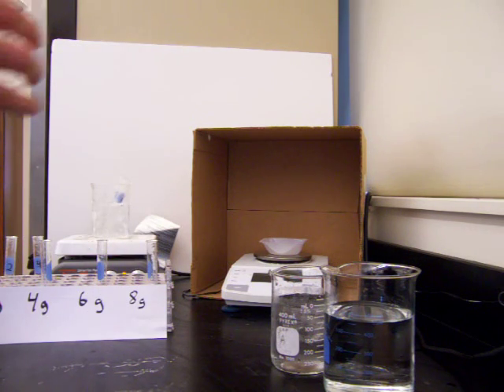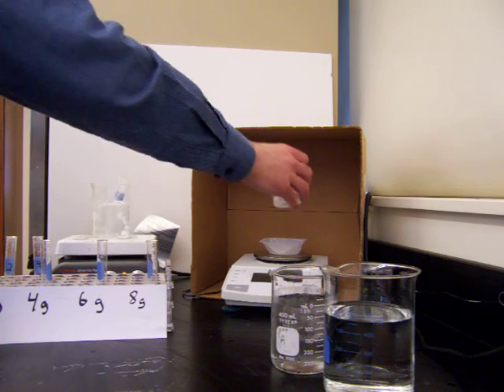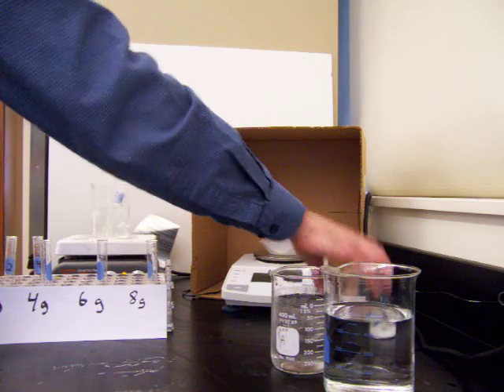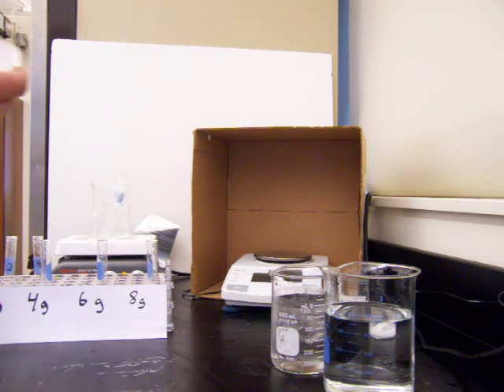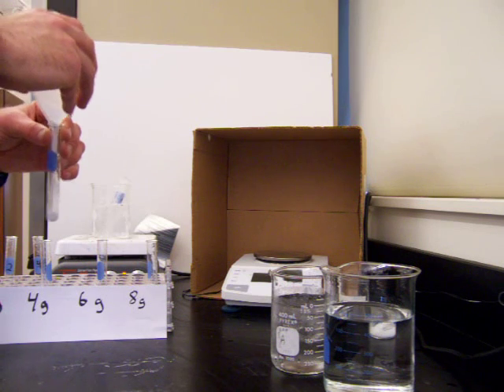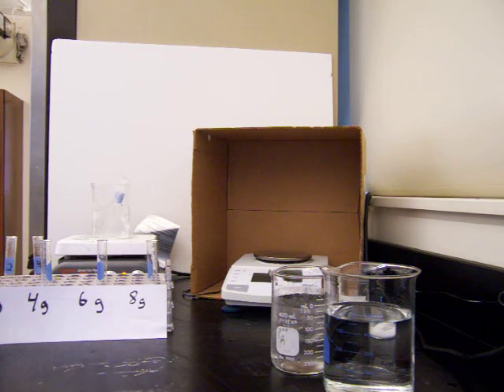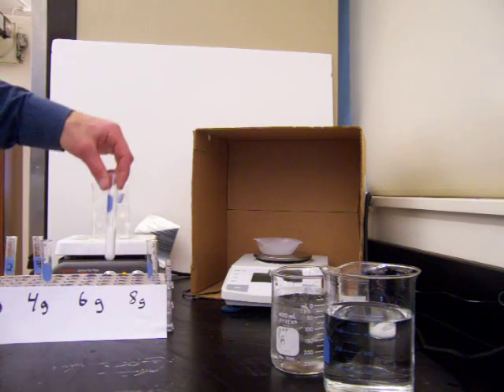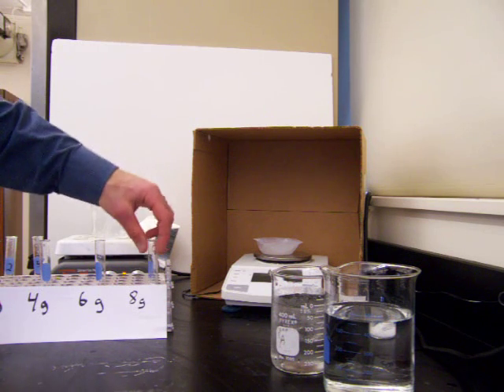First thing we're going to do is measure out a 2 gram sample of potassium nitrate. We measure that out in our balance. We'll take our 2 gram sample of potassium nitrate and put that in a test tube. Then we'll repeat that process with a 4 gram sample, a 6 gram sample, and an 8 gram sample, which I've already measured out.